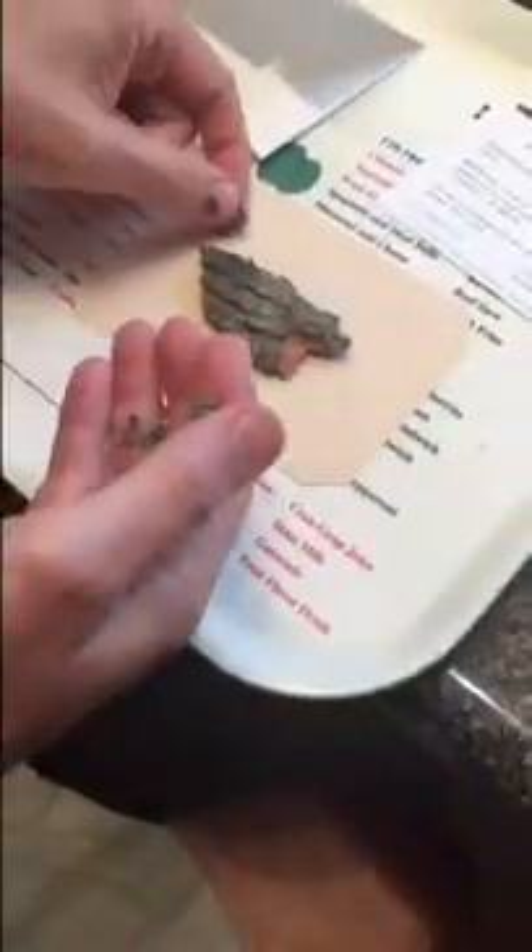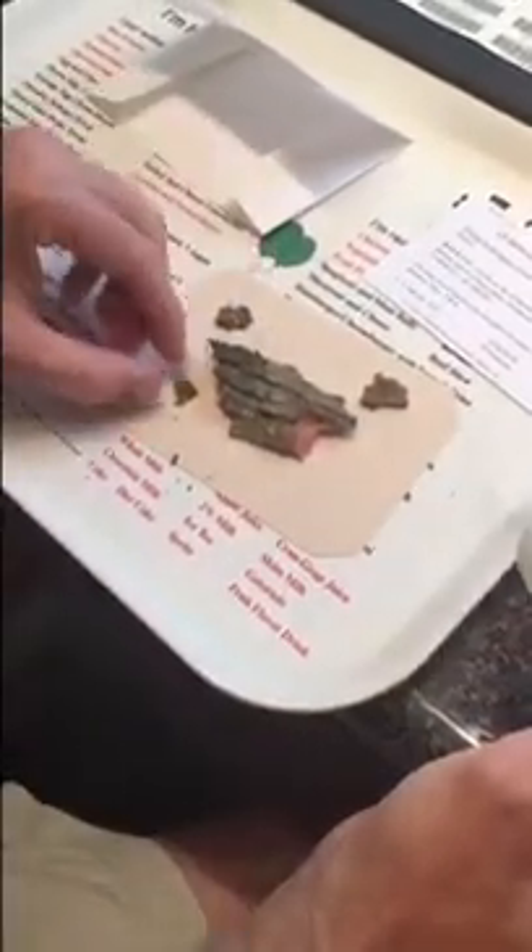We'll take our first specimen here and pull it out of the sack. Sometimes it's in little pieces depending on how the bark has broken up. You can see on this piece of bark there are little tiny bumps — that's a lichen called Porina. I'll save the biggest pieces and begin gluing. I turn it over and put glue right onto the bark, not on the lichen specimen itself, just along the edges where it will contact the cardboard. I give it a light press to glue it, then quickly glue the other pieces onto the cardboard as well.